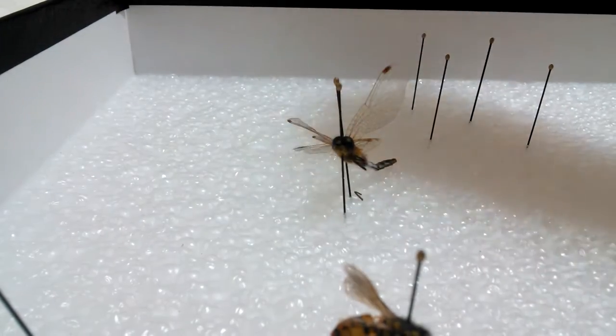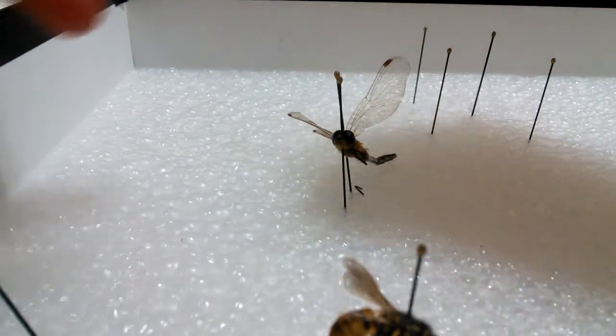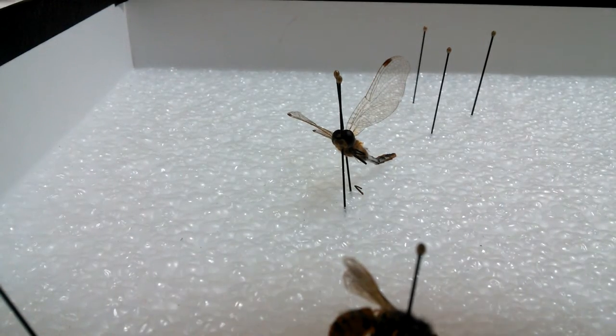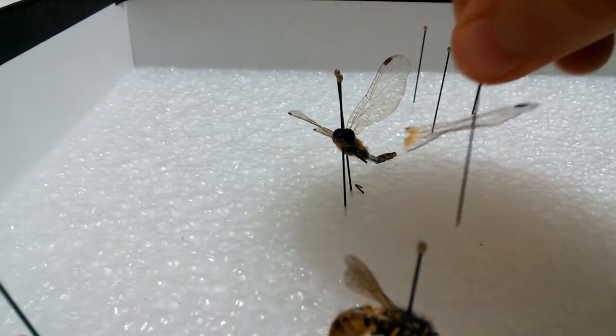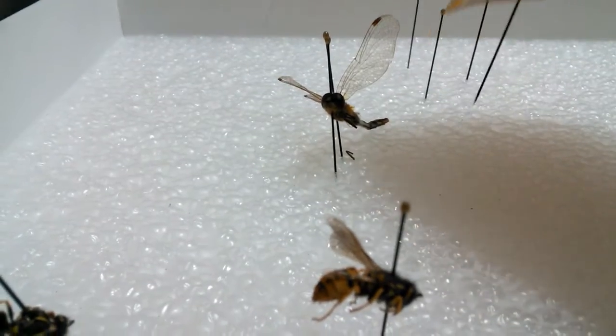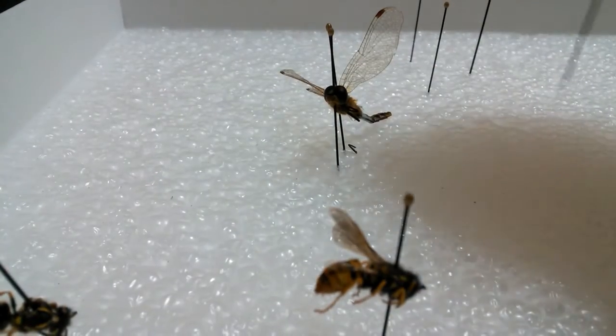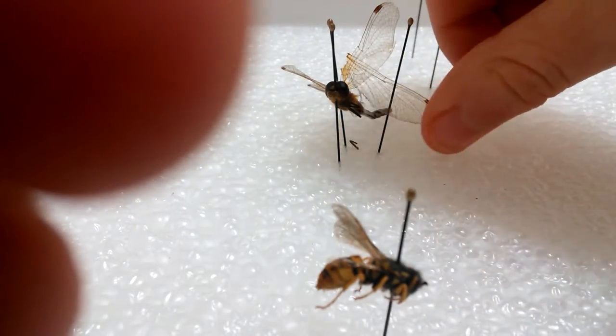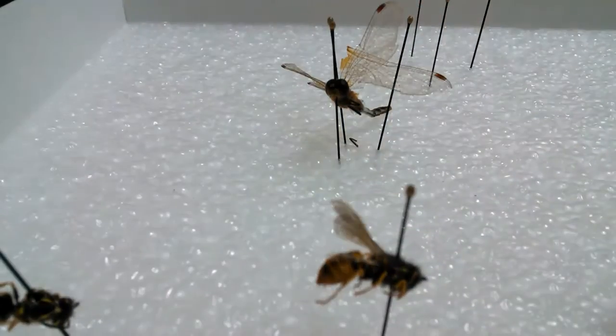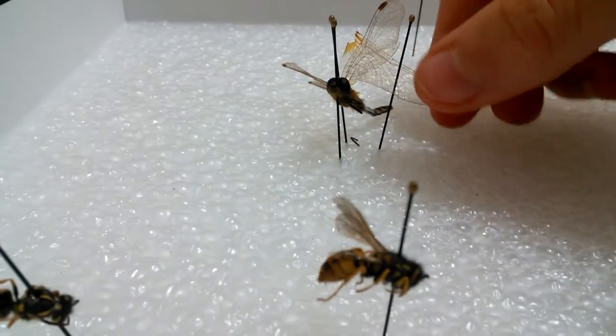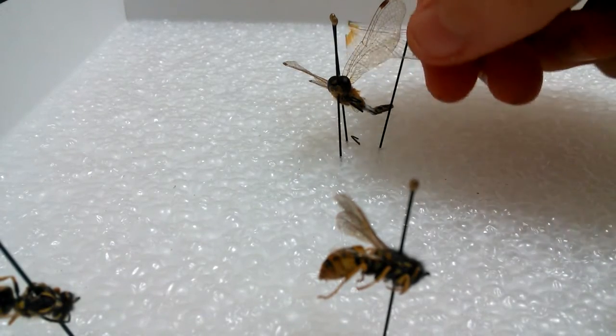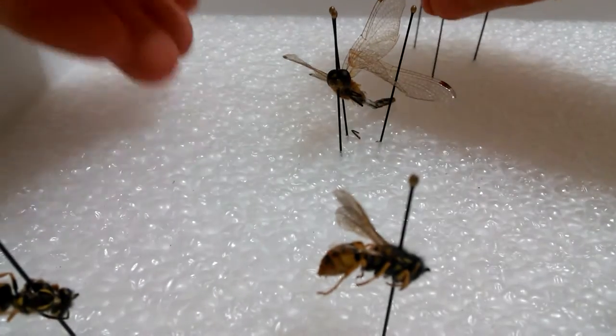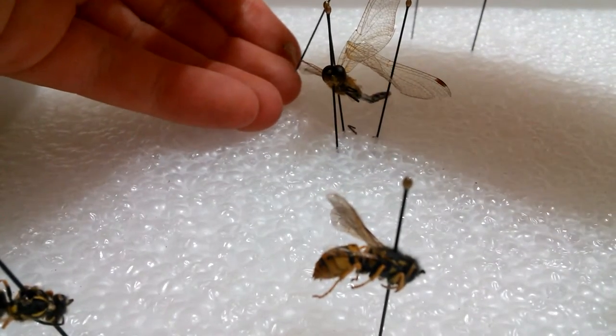Next you need to pin on a wing, which is not so easy. It doesn't work as well, it's harder. And you need to pin in any remaining wings.